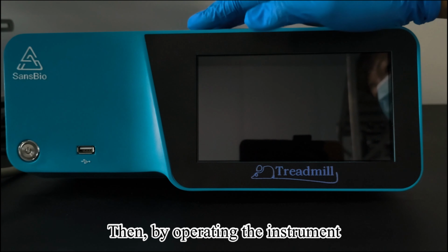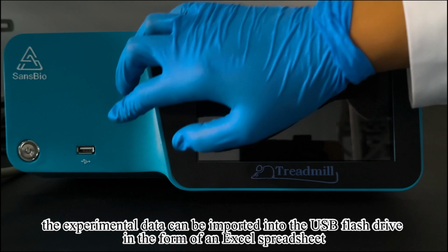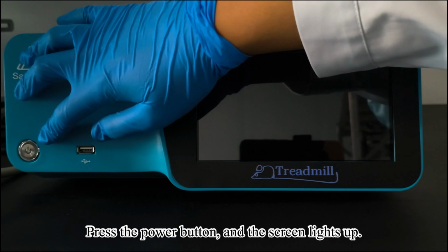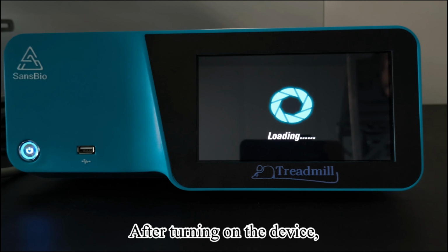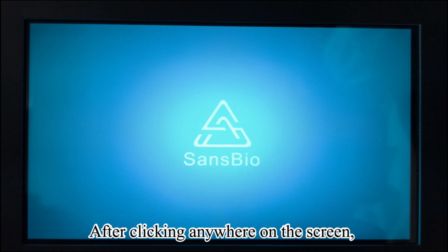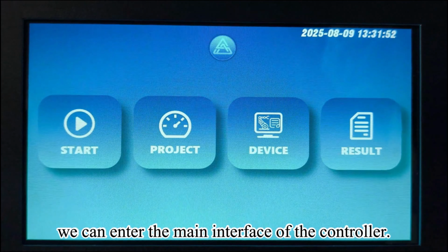Then, by operating the instrument, the experimental data can be imported into the USB flash drive in the form of an Excel spreadsheet. Press the power button and the screen lights up. After turning on the device, the instrument will automatically enter the standby interface. After clicking anywhere on the screen, we can enter the main interface of the controller.